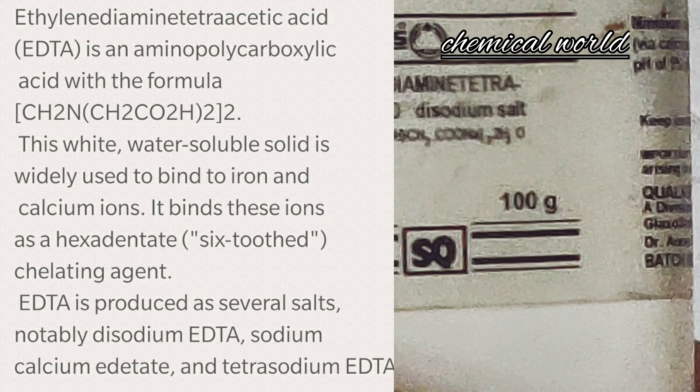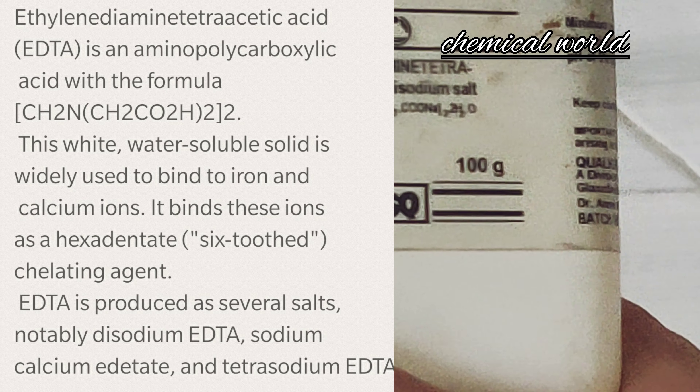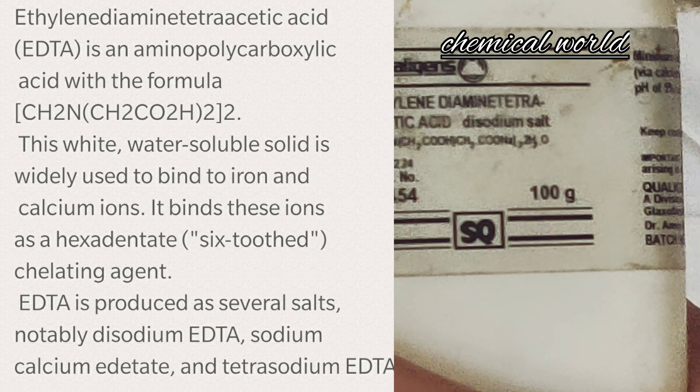Hi, today I am here with a new video about one of the most important reagents available in our laboratory. It's ethylenediamine tetraacetic acid, generally known as EDTA.